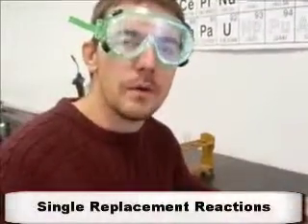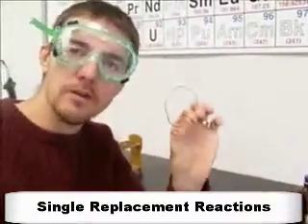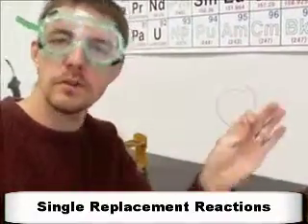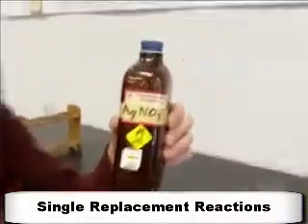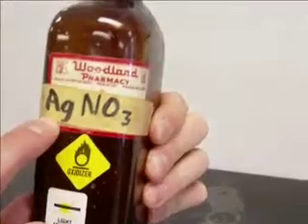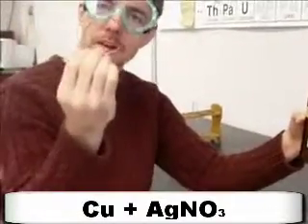Okay, what I want to demonstrate for you now is a single replacement reaction. Now in a single replacement reaction, we start with an element. In this case, we're going to use copper, solid elemental copper, so just plain old Cu, solid. We're going to add that to an ionic compound. This is silver nitrate, AgNO3. Okay, so we have a metal ion and we have a metal atom.